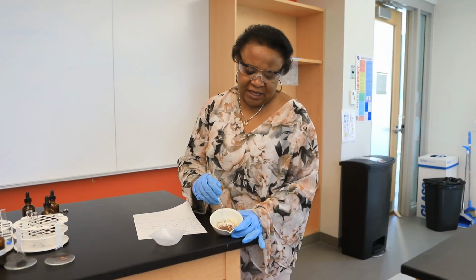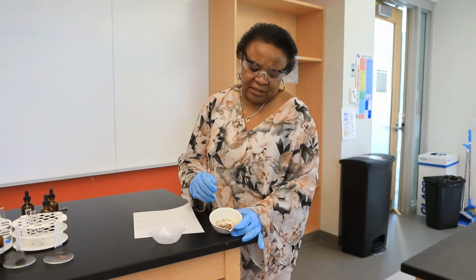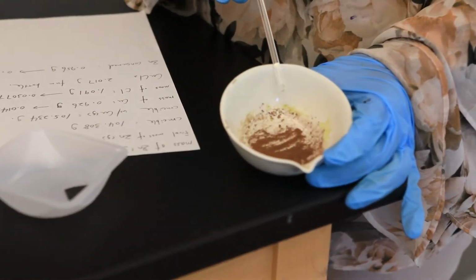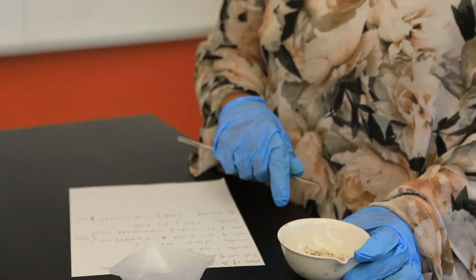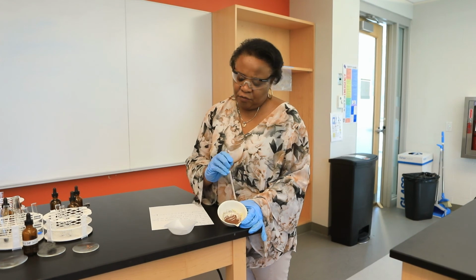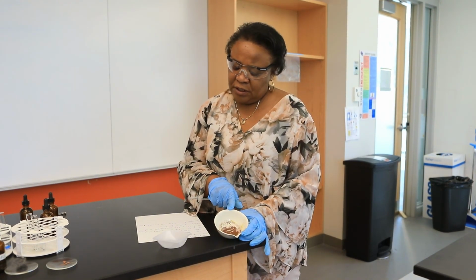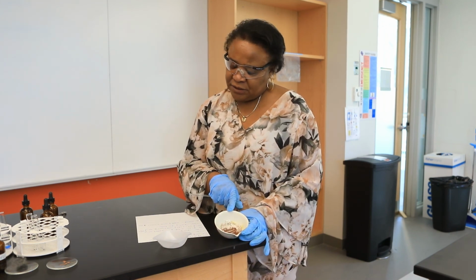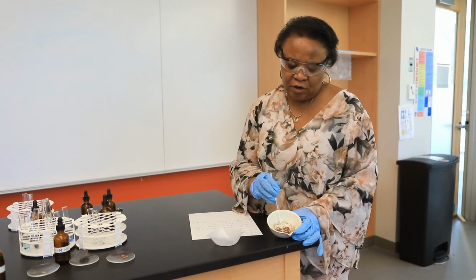Alrighty, so now that the copper is completely dry, you should be able to recognize that it's a reddish brown solid. Initially, when we started this experiment, the mass of this empty crucible was given to you as 104.308 grams. So I need for you to now realize that the mass of the crucible and the copper is 105.234 grams. And so just by difference, you should be able to report the mass of that copper.